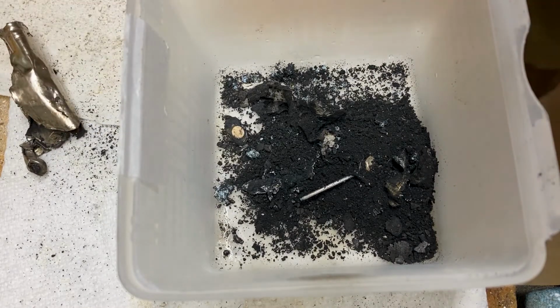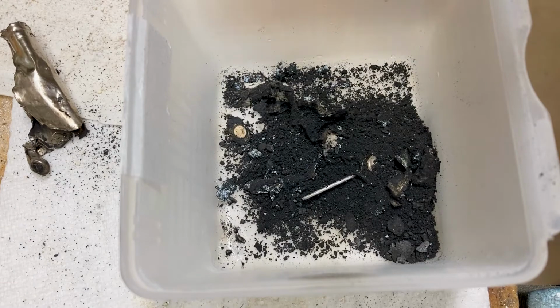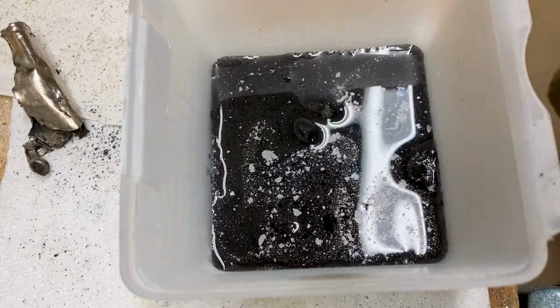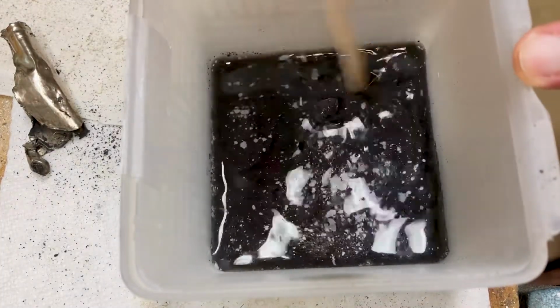All right, so what I'm going to do with this is I'm going to mix in some water, and I'm going to use that to try to dissolve out the potassium hydroxide that's in there. The zinc oxide, leftover zinc, and the manganese oxides will not dissolve in the water, so the only thing that's going to dissolve is just the potassium hydroxide, which I want to get rid of. Okay, so I'm going to add a little bit of the distilled water here. And I don't think I need to put that much in, because the reality is I'm only really trying to get this just wet enough to be able to get rid of the potassium hydroxide.